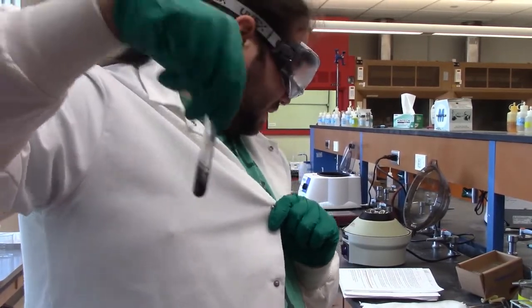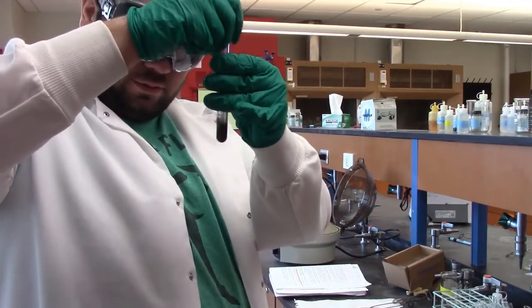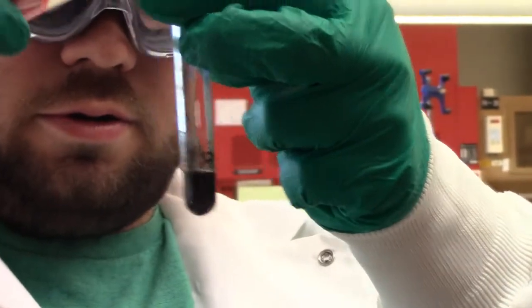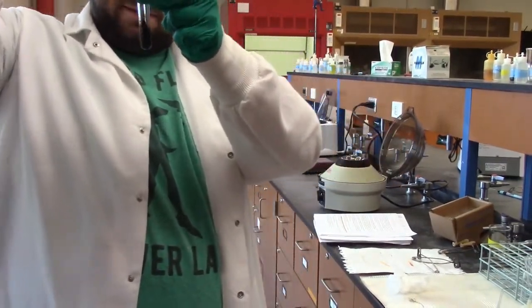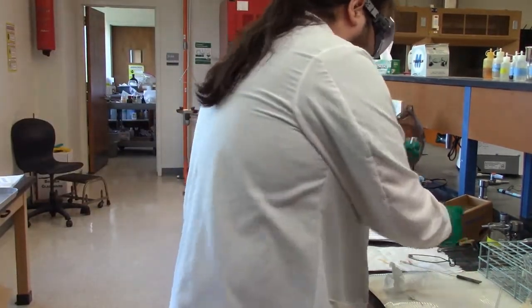Okay, so give it a good mix. Stick a stir rod in there to give it an extra good mix. And this time, instead of centrifuging it, we're going to heat it again. Oh, wait. Got to add 1 drop of thioacetamide. Sorry, guys. Forgot about that. 1 drop of thioacetamide in there. Give that a good mix again. Get the thioacetamide going. And now we're going to heat it for 2 minutes. So I'm off to the hot bath. I'll see you momentarily.